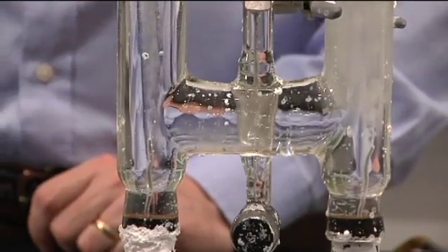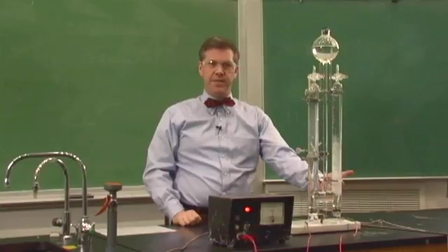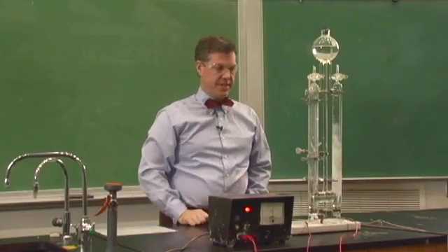Here we're separating the water, H2O, into hydrogen gas on this side and oxygen gas on this side.